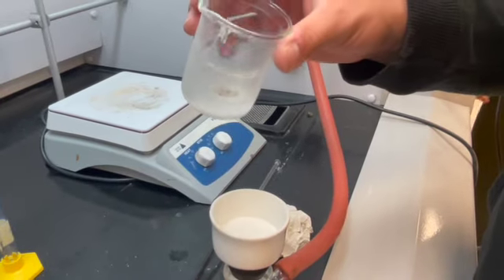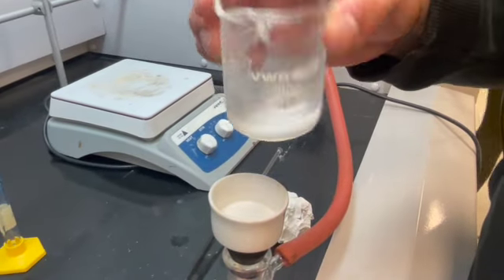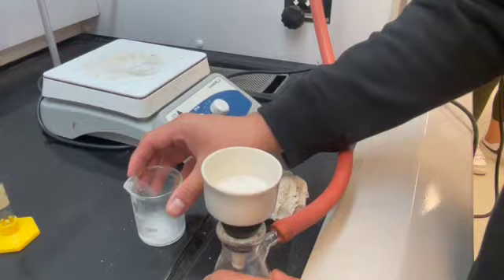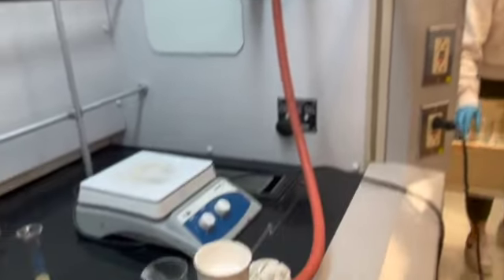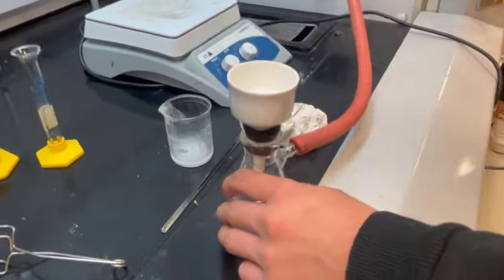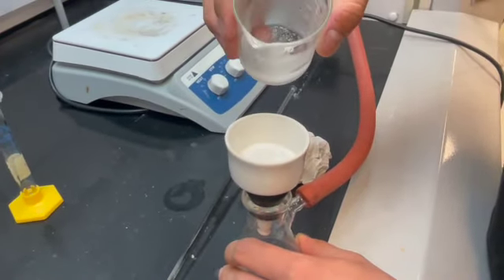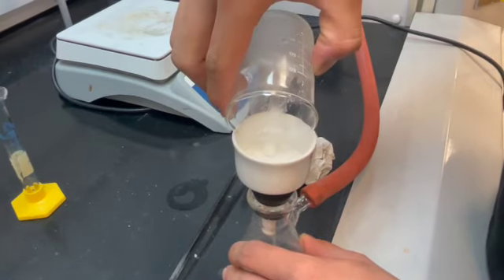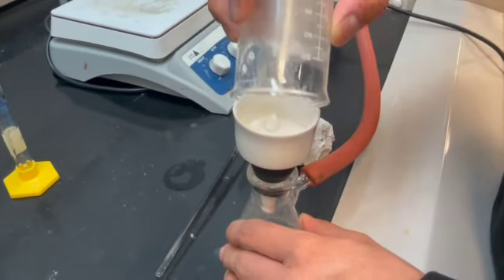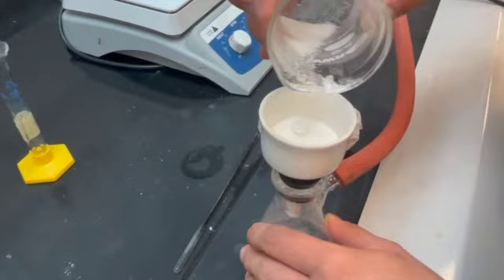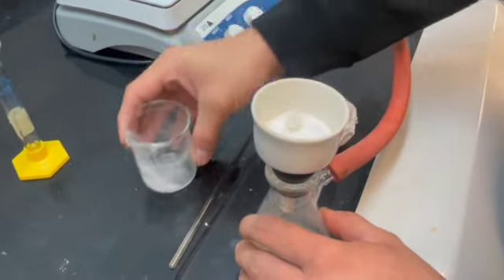Now we will vacuum filter our solids that are remaining due to recrystallization. We still have a lot of solid left behind.